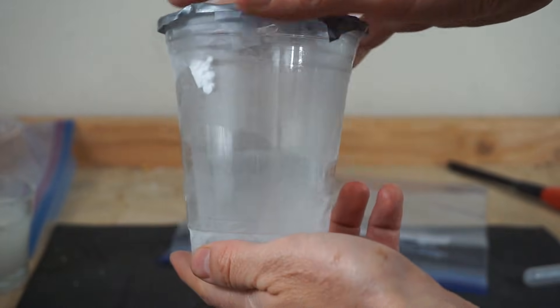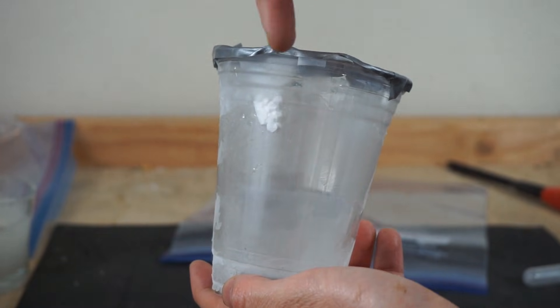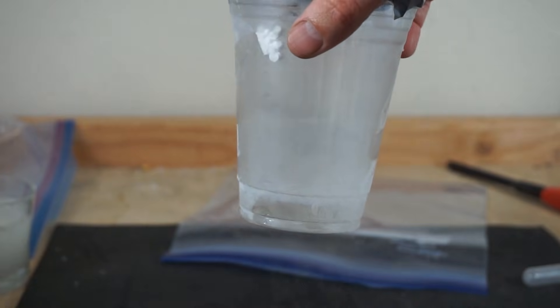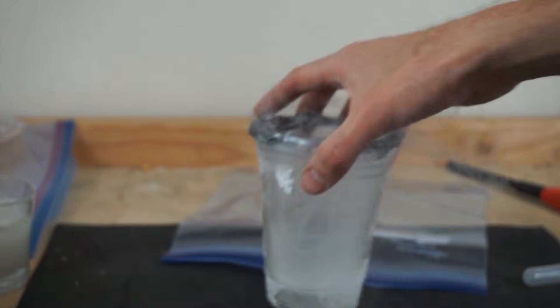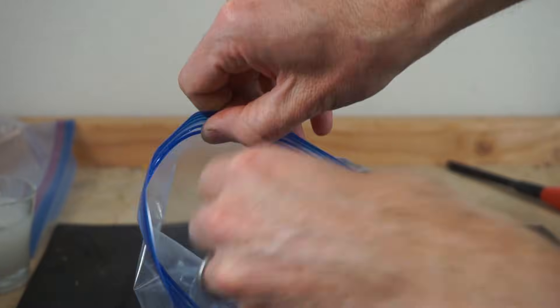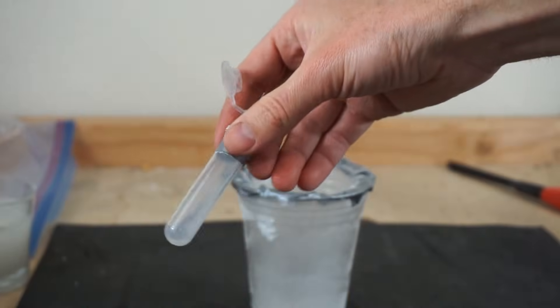So you could do this if you had some compressed oxygen - you could run it through liquid nitrogen in a tube and it would condense out. But I'm going to show you the simple, easy way to do it, and that's just to get a bag, fill it with air like this, and then connect it to a test tube.